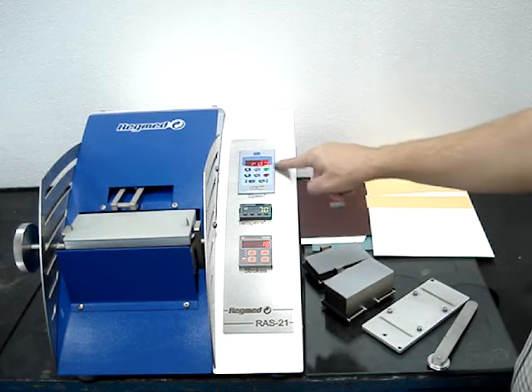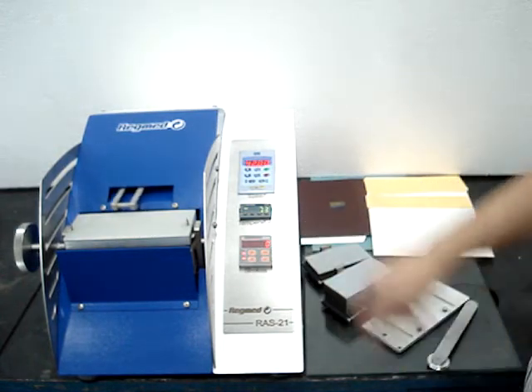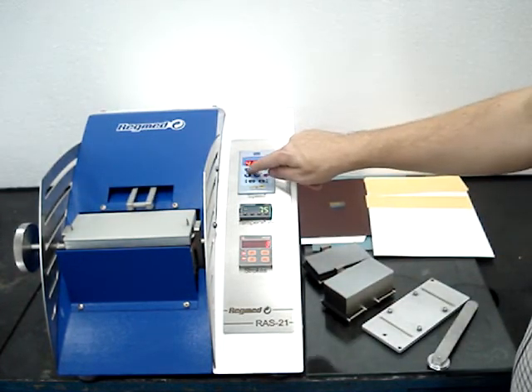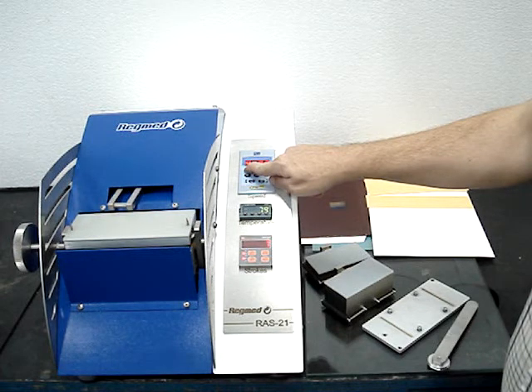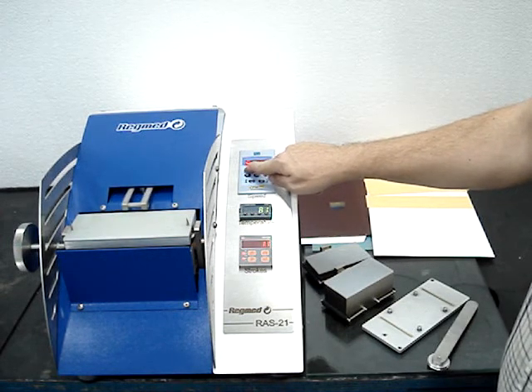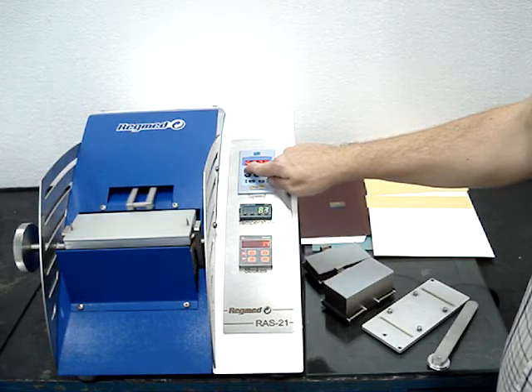To adjust the test speed, start a test. While the unit is running, use the up and down arrows to adjust the temperature and speed. It's a linear system based on a frequency inverter and you can adjust within the limits.